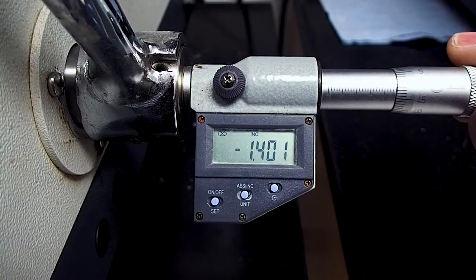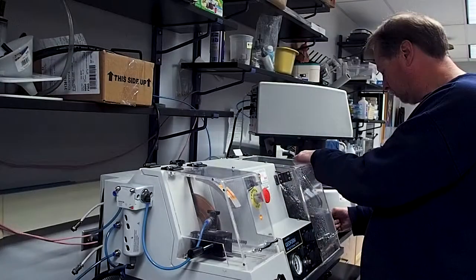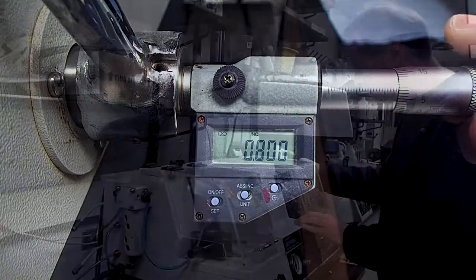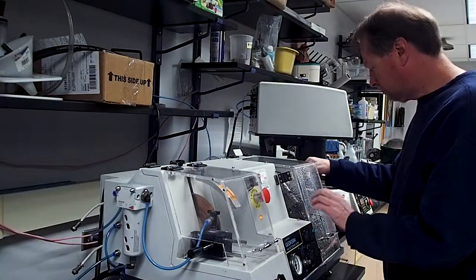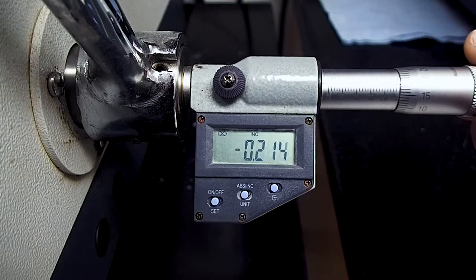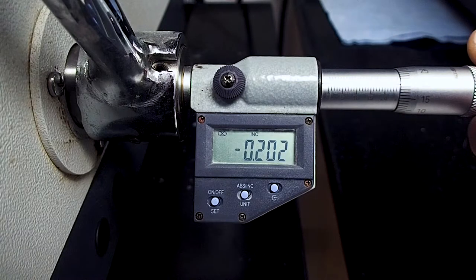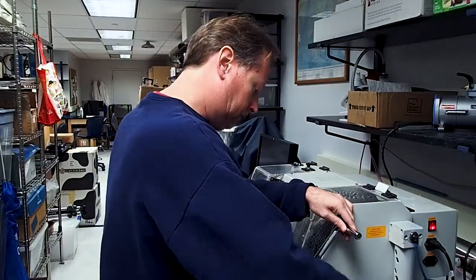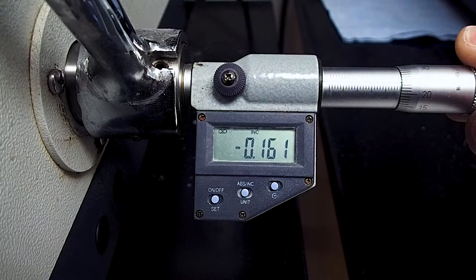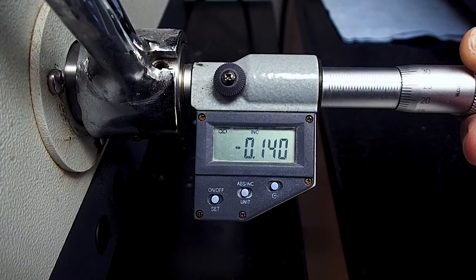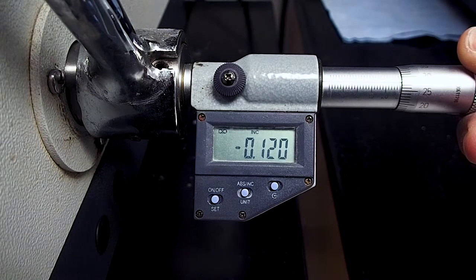Continue this process of grinding and advancing your slide in 100 micron increments until you have reached an approximate thin section thickness of around 200 microns. From this point forward, continue the grinding process but advance your slide in 20 micron increments instead. Your rock sample will be getting quite thin by now, so you will want to proceed even more slowly and carefully, especially if you are using powered equipment such as the Geoform.